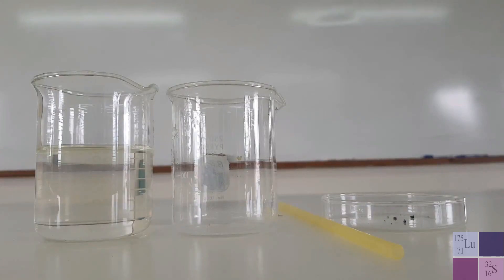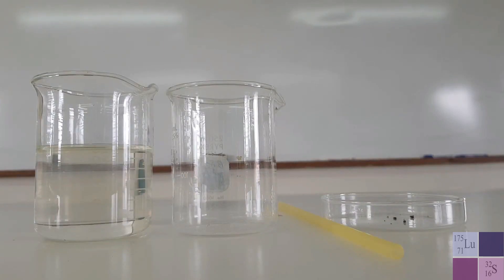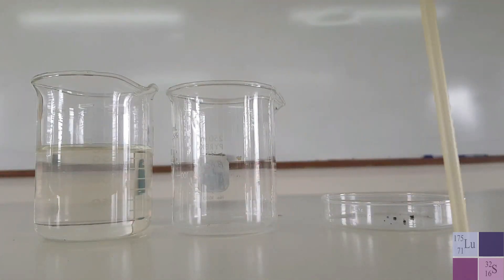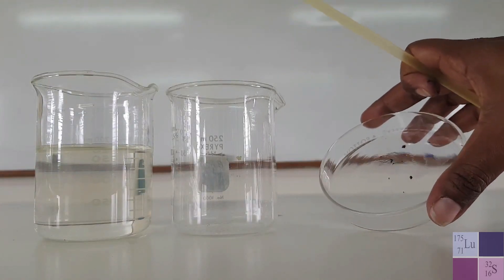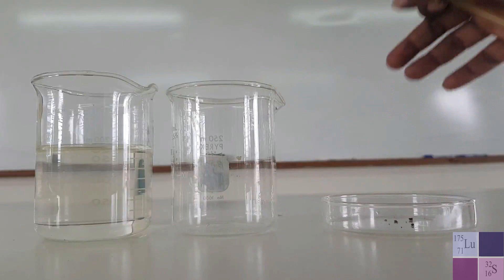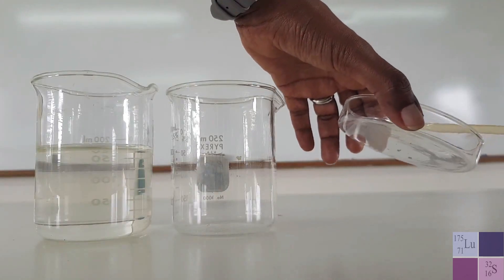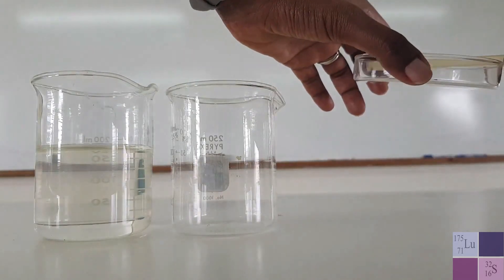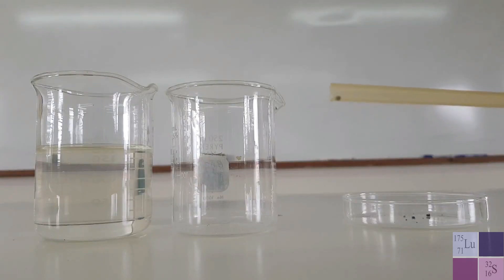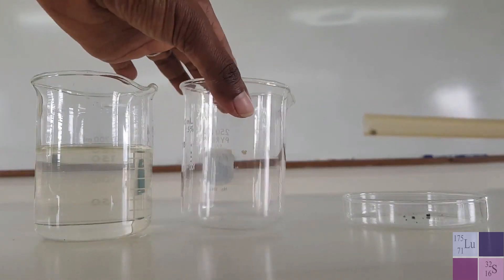Let's get started with trying to investigate the diffusion of potassium permanganate in water. Here we have a straw, and we are going to use it to pick up a single crystal of potassium permanganate — I have a couple of crystals here. It looks black but it is actually a dark purple color. I'm going to try to pick up a single crystal into the straw. In our straw, you should be able to see the crystal there.